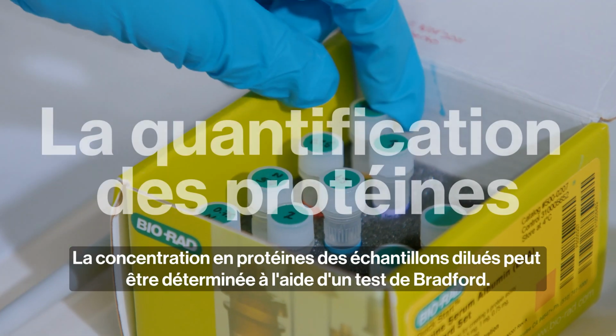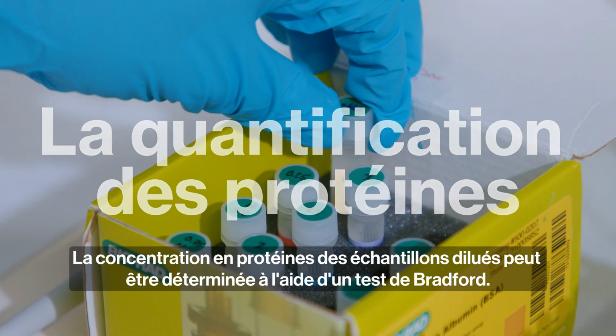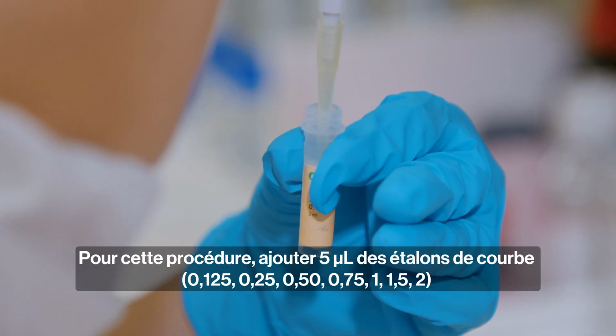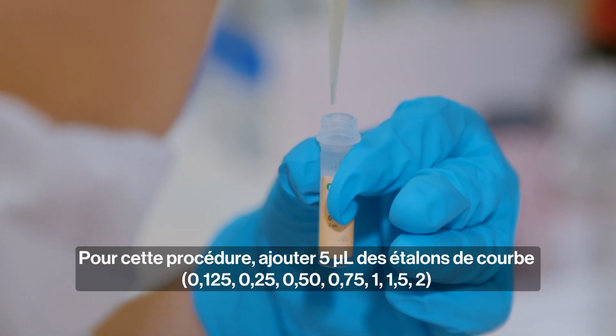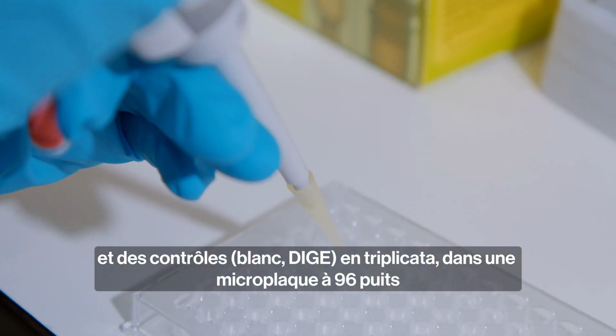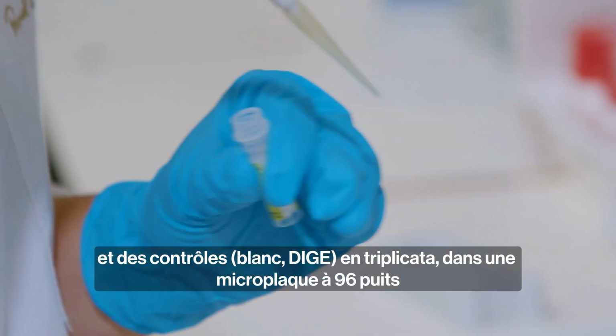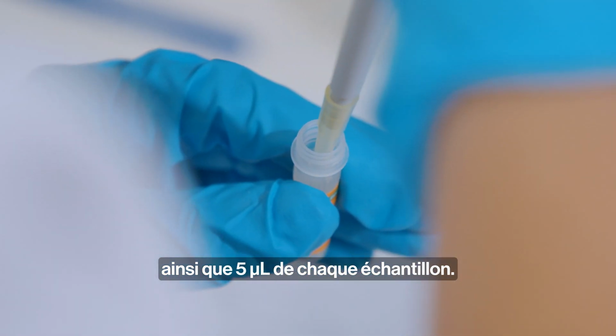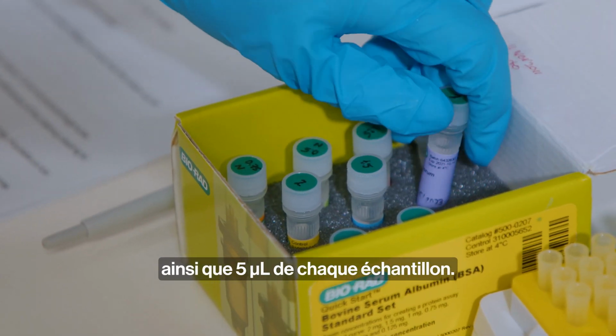The protein concentration of the diluted samples can be determined with a Bradford assay. For this procedure, add 5 microliters of 7 curve standards and the 2 controls, blank and DIGE, in triplicates to a 96 well microplate along with 5 microliters of each sample.